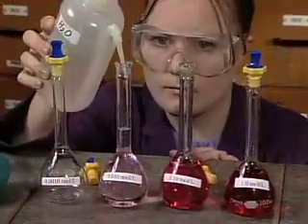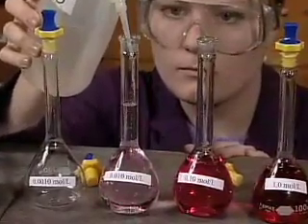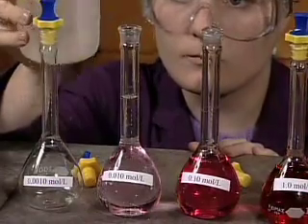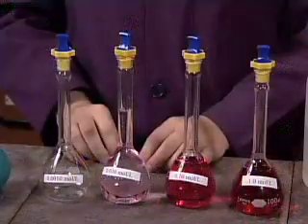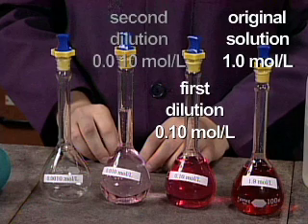It is topped up to the 100 milliliter calibration line with deionized water. The second dilution yields a solution 1/100th as concentrated as the original. Again, we see a decrease in the color intensity.